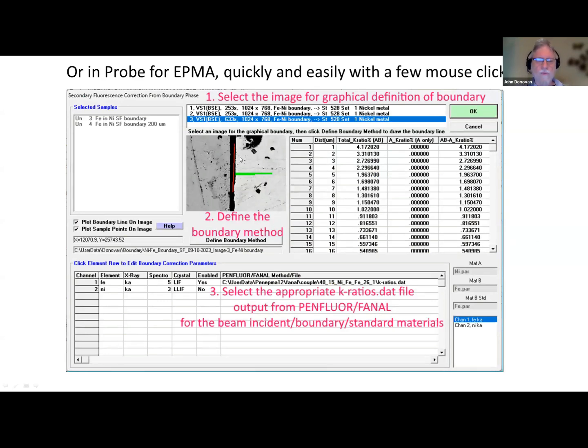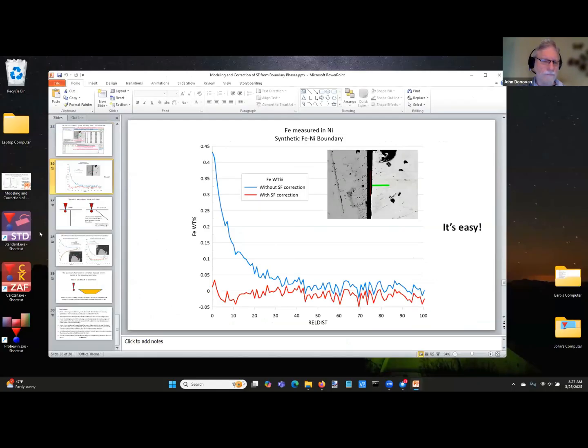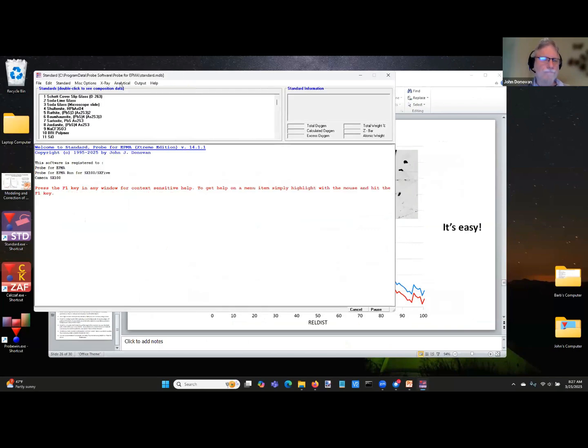You open up the boundary correction window, you specify the boundary, here are your analysis points, and maybe if we have time, I could actually do this. Do I have time, Ioannis, how are we doing? More than 10 minutes, or less than 15, okay. Fifteen, okay. I'm going to run standard, okay?